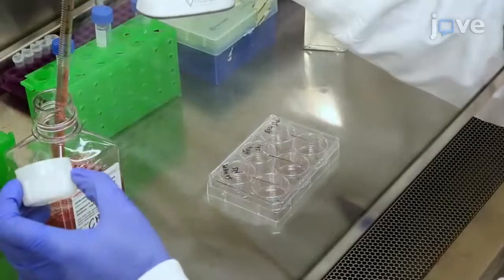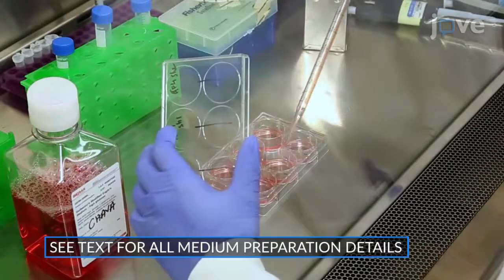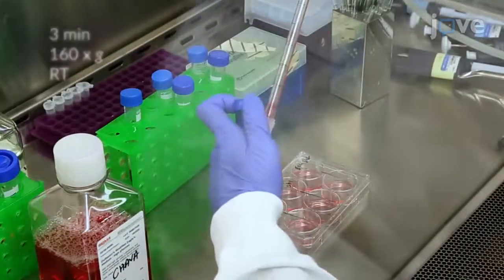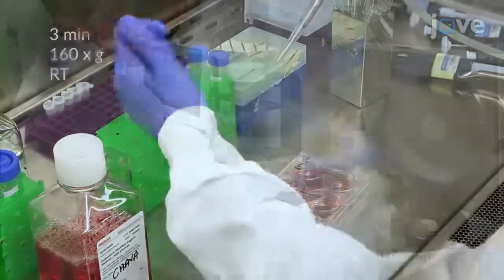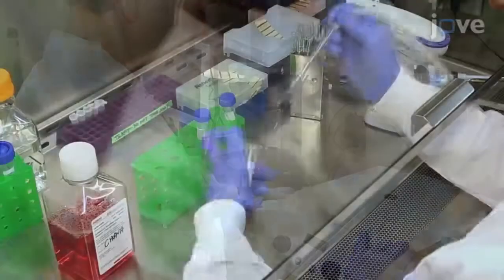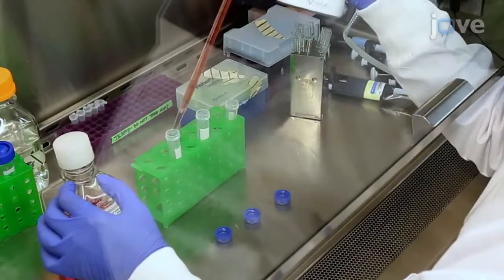When a single cell suspension has been obtained, add 10 milliliters of cell culture medium to the cells and transfer the cells to a 15 milliliter conical tube for centrifugation. Wash the cell pellet with 5 milliliters of PBS before resuspending the cells at a 1 × 10⁵ cells per milliliter of fresh culture medium concentration.